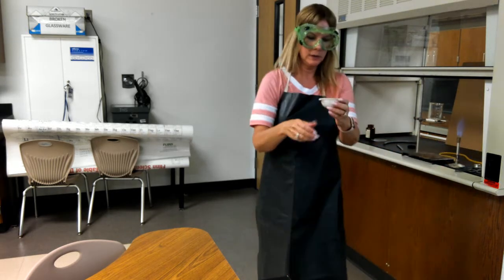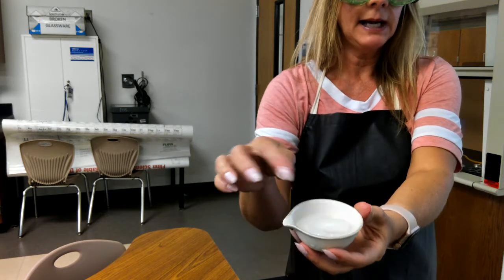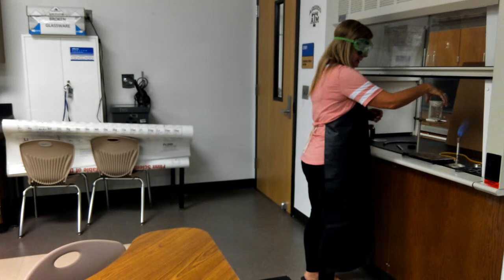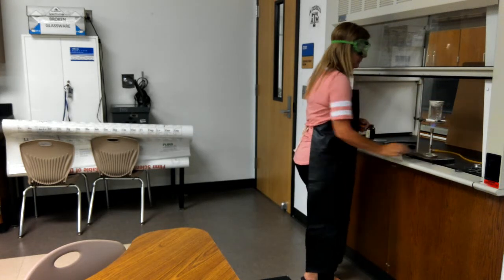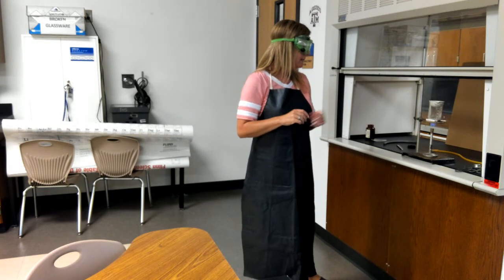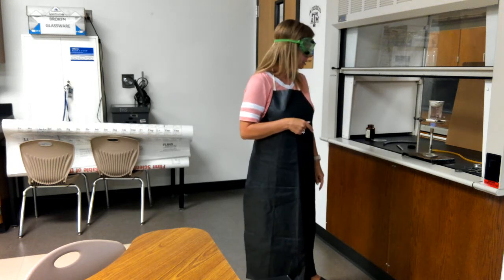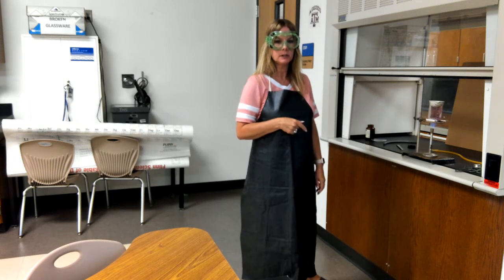Okay, now I want to show you what else we have: just an evaporating dish with some ice in it, so you know what's going on. I'm going to put that on the top, and then I'm going to heat it with the Bunsen burner. And remember, it started out as a little gray solid, and it's going to take a minute, so just be patient. I'll come over there and show you once it gets going, but I have to do it over here in the hood because those vapors are pretty toxic.